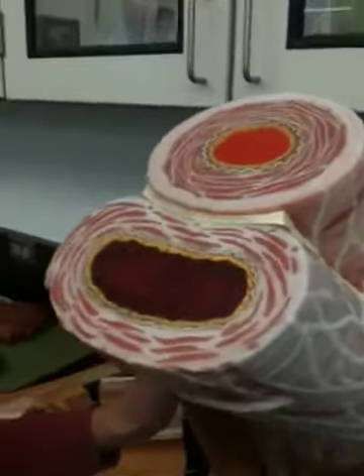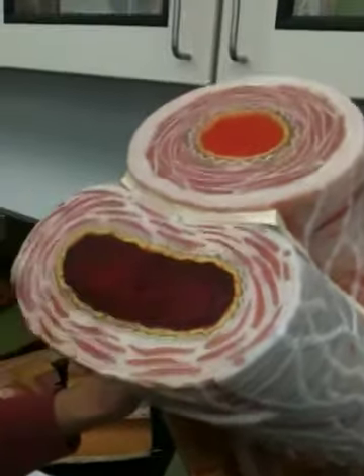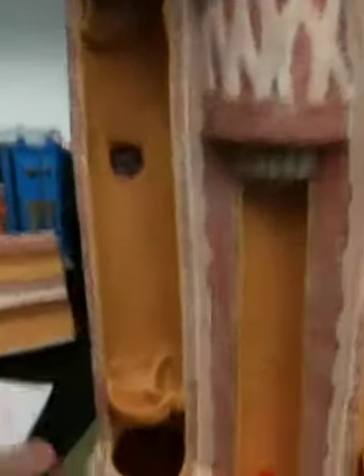All right, so here we have the vein. Once again, tunica externa, tunica media, and tunica interna. Okay. So it's absolutely the same on arteries and veins, right? Yes, it's just the layers, the tunicas. And the capillaries only have endothelium and a basal lamina. Okay, they're very thin. And the veins have the venous valves here.